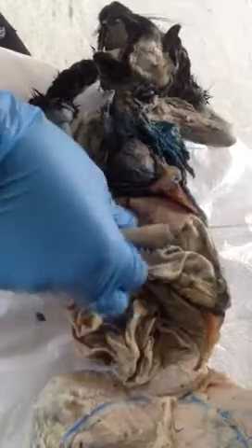So I'm going to lift up the liver so you can see the lesser omentum fat. Here is all this fatty tissue — you can see right here — this is the lesser omentum. And here is the stomach.